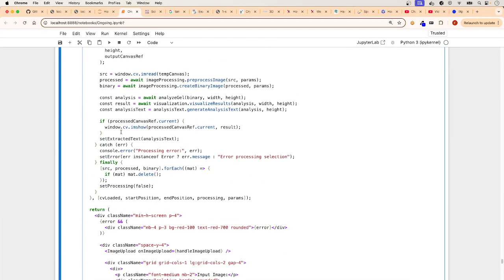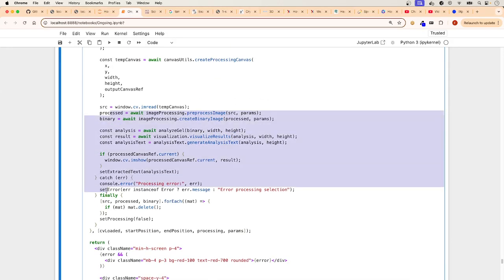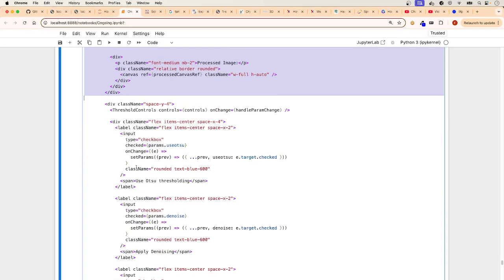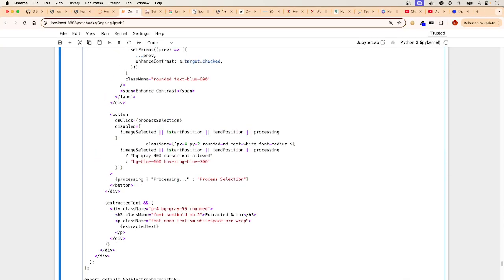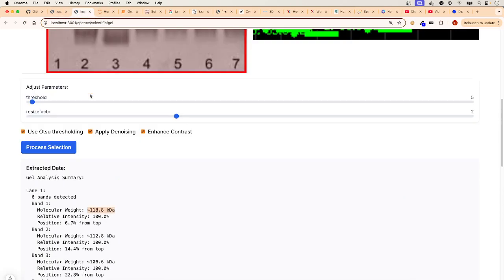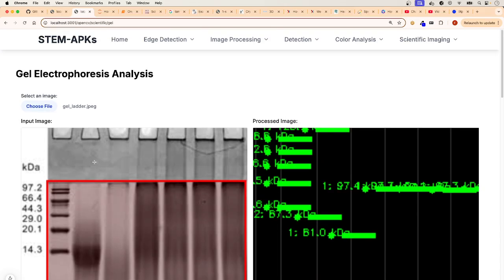And now it goes into processing and the rendering. And these have been the same all along. And that's what's happening here. And this is where the containers look the way they look, like here. Okay. And that's it for gel electrophoresis.